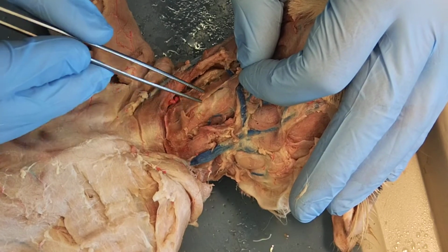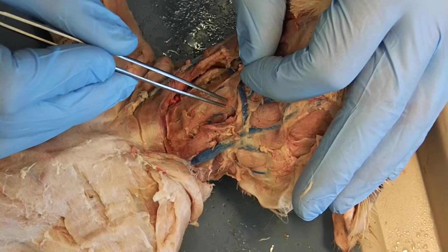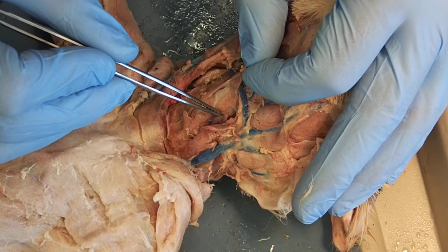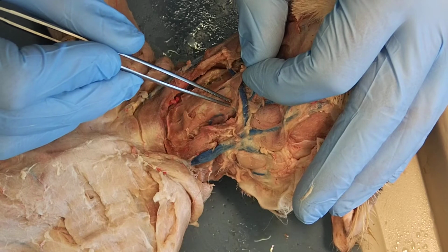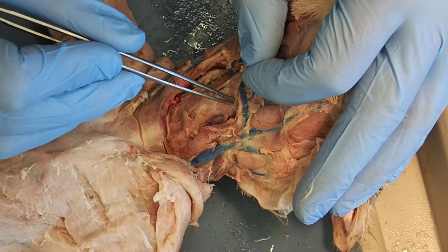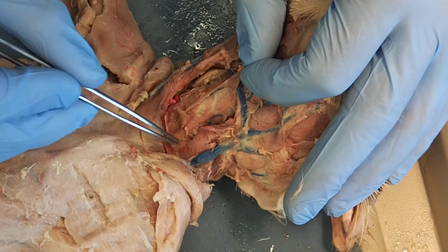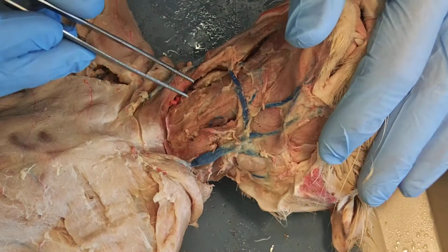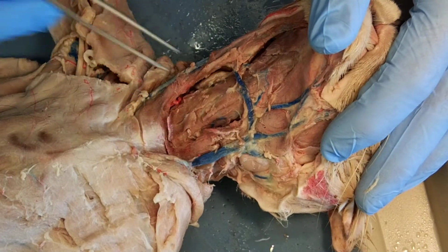Then I have, running from the thyroid area up to the hyoid, the other deep one that's more anterior, sitting on top of the larynx, running from where the thyroid would be to the hyoid, is the thyrohyoid. The thyrohyoid. Sternothyroid, and then sitting superficial to all of those on top is my sternohyoid.